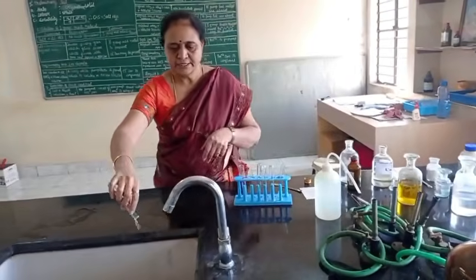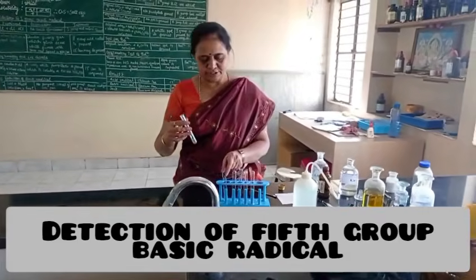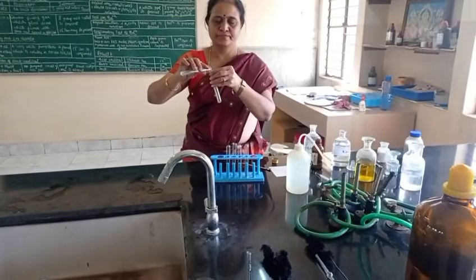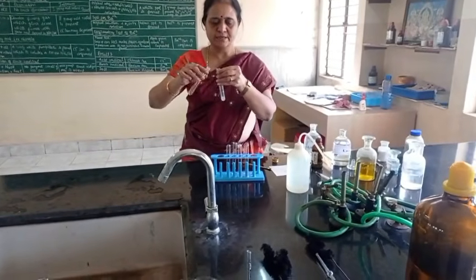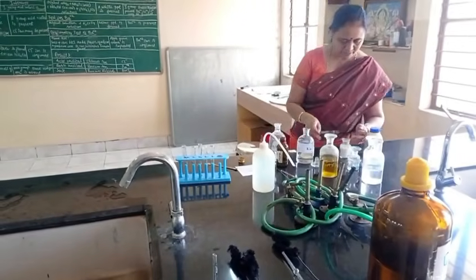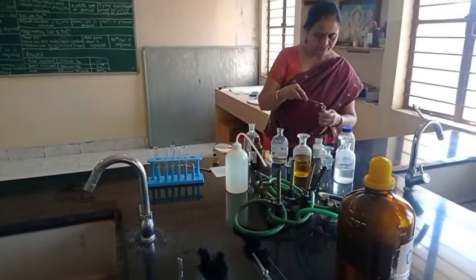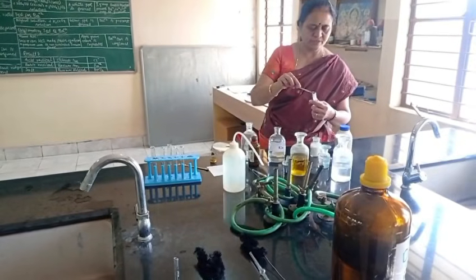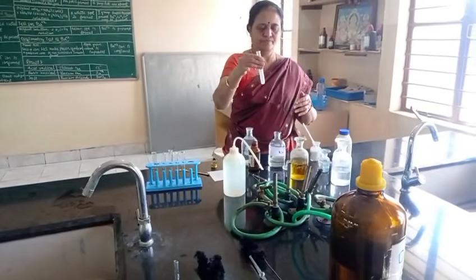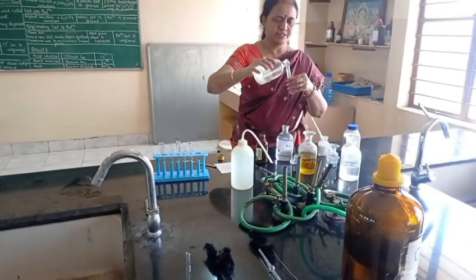Then I move to detection of fifth group basic radical. For fifth group basic radical, I am taking original solution. For this original solution, I am adding solid NH4Cl, then NH4OH excess.